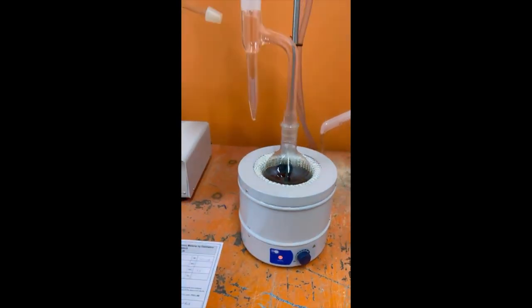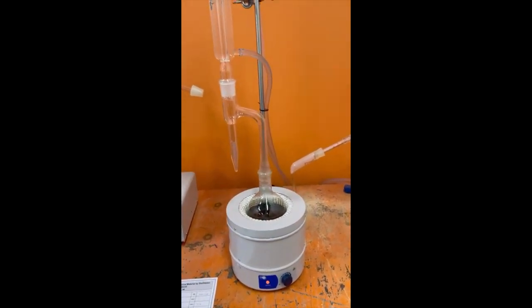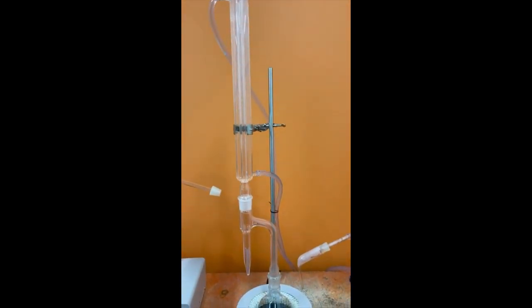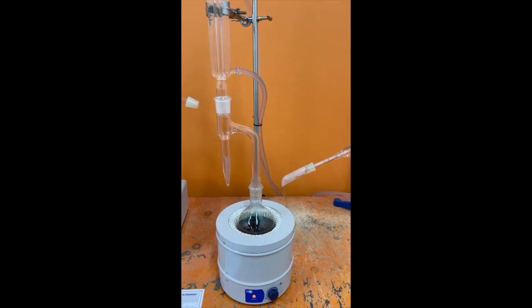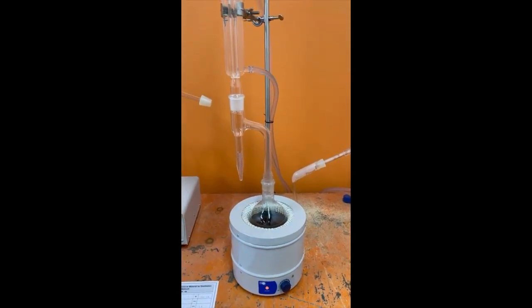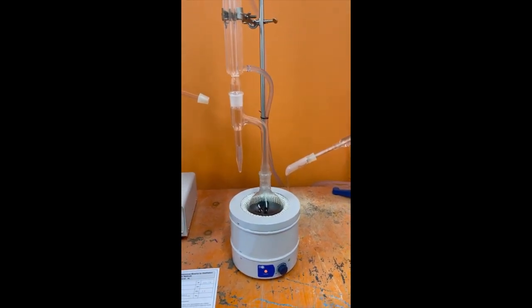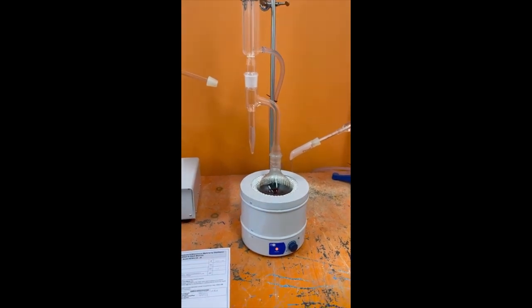This is the apparatus setup for the test. And here the solvent carrier liquid I used is an aromatic solvent. The example is an industrial grade xylene we used.